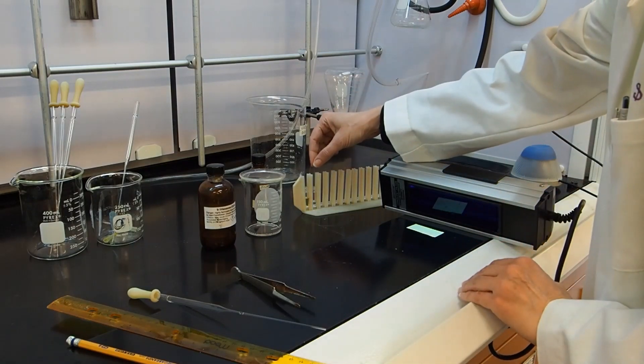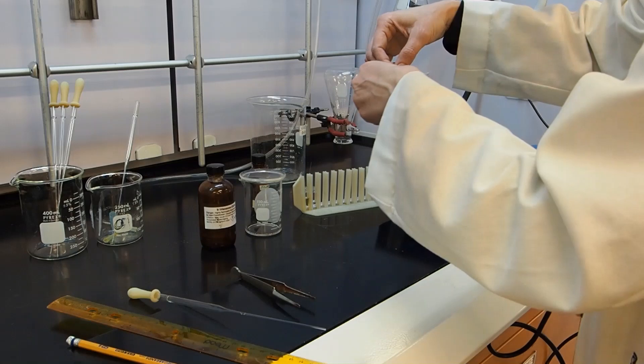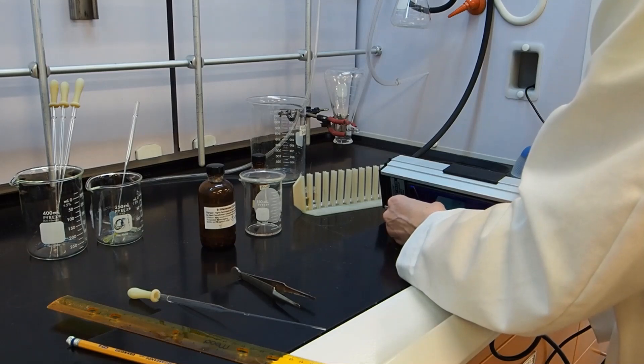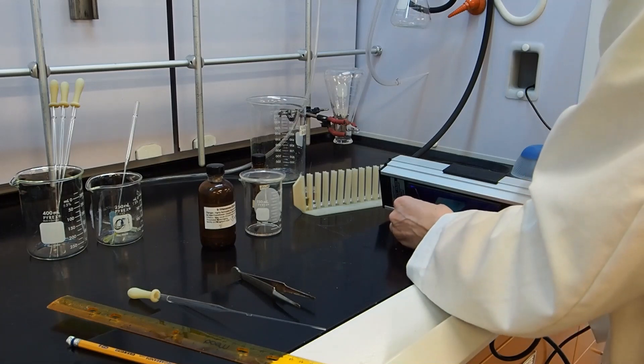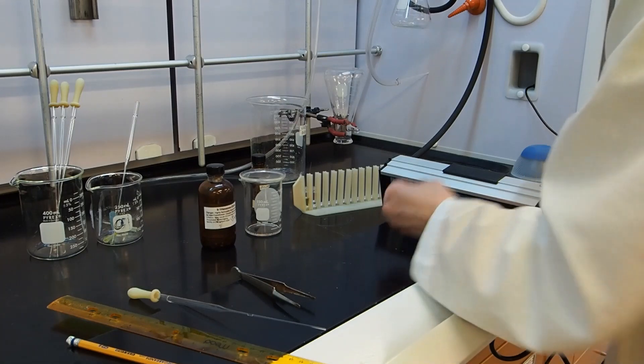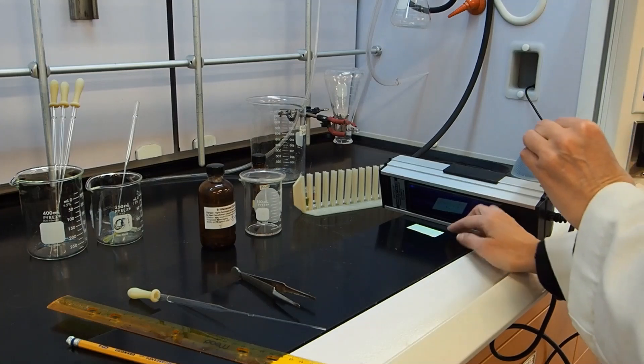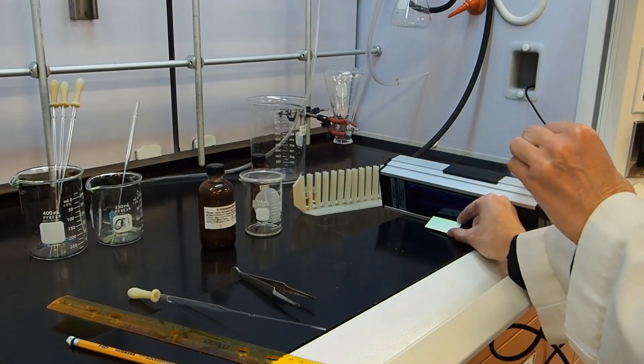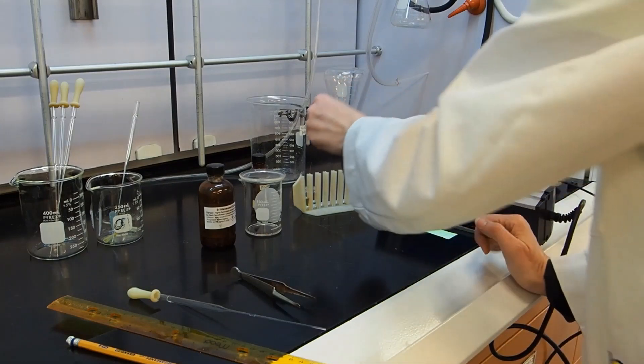Now I'm going to take my reaction solution and do the same thing. This is probably going to be a lot more dilute, which is why I'm spotting it underneath the light so I can make sure that I'm going to have something to see. So I've spotted it several times. I can see underneath the light that there are spots for each of those.